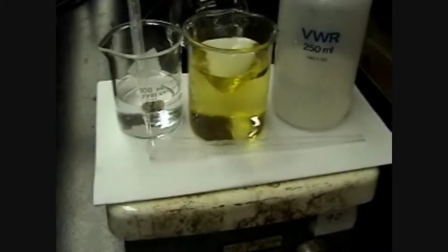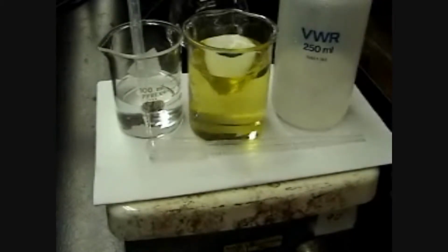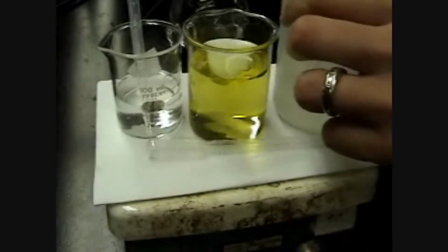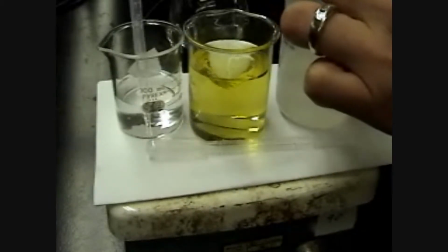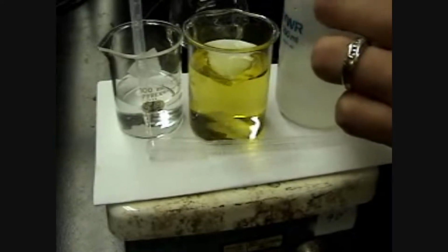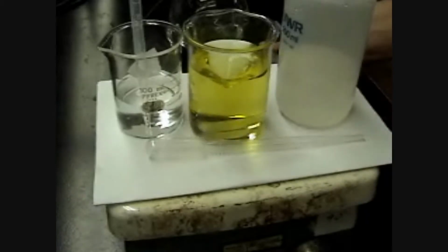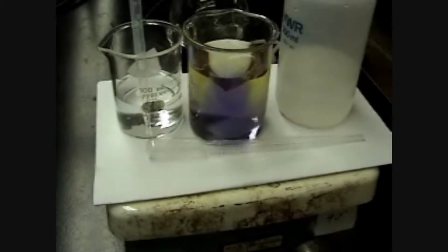You'll see that obviously that changed the color there of what we're looking at. Now this hydroxide is, if you think about how concentrated the sulfuric acid was, it was 0.1 molar. So that means that this sodium hydroxide is 40 times more concentrated. So I should be able to get it back to blue by using 40 times less. So maybe even just one drop of this stuff. Yep, you can see one drop has a dramatic effect.